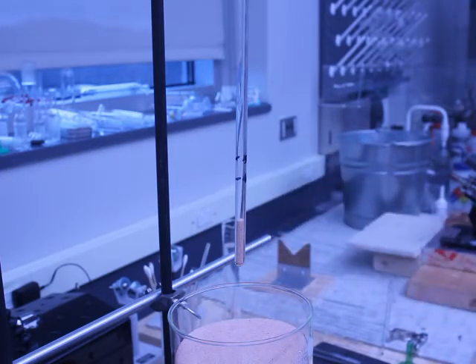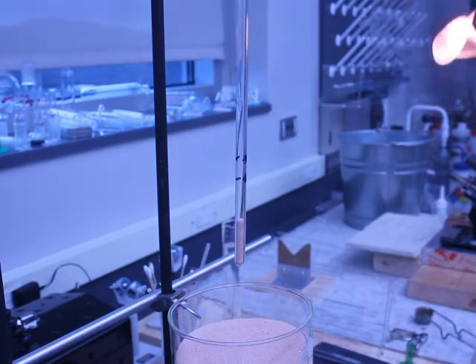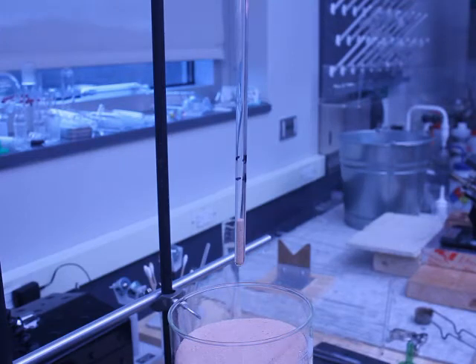So this is just sand, and I just pulled a vacuum on the tube. It's not a super powerful vacuum. In other words, it's not like the type of vacuum you would get from some of the more advanced vacuum pumps that we have in the lab, but it'll get the job done.